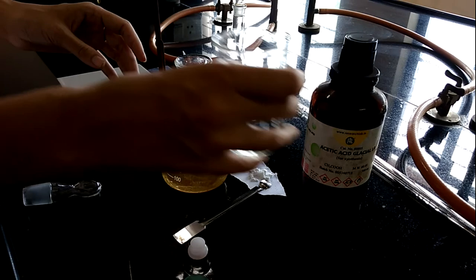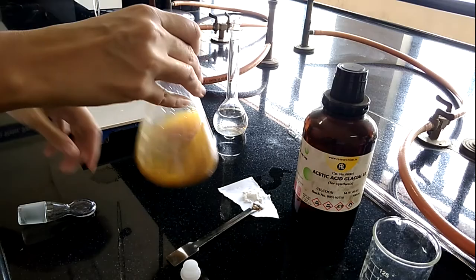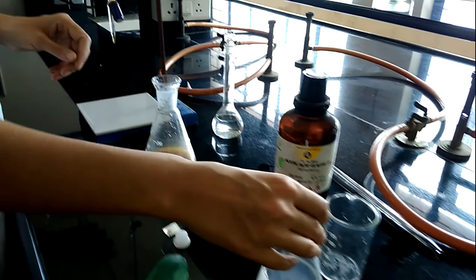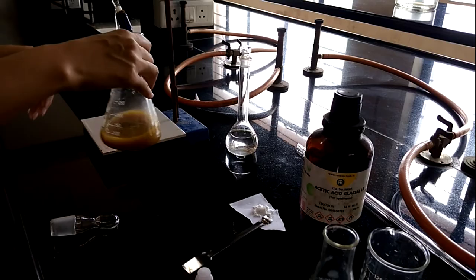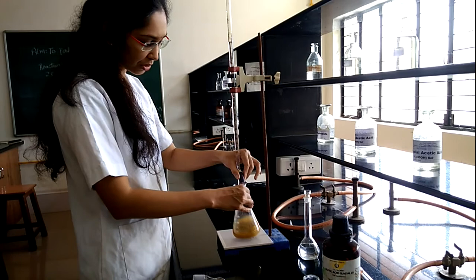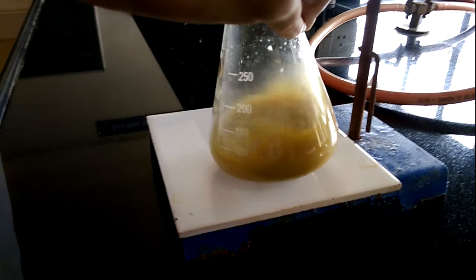Now we have to make up the volume to 100 mL — we already have 25 mL of water, so we add 75 mL more. Now we will start the titration. The indicator we are going to use is starch paste, but it has to be added at the end, because if added initially a strong bond will form between iodine and starch that will not break. So we will first start the titration to reduce some of the iodine. You can see the colour is becoming pale as sodium thiosulphate reduces the iodine.